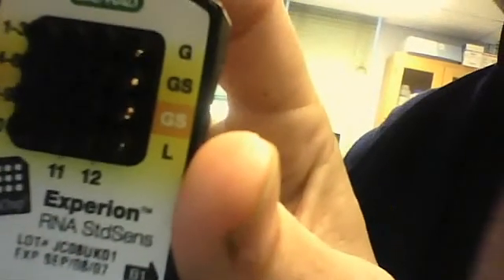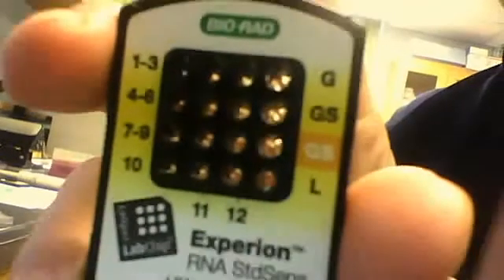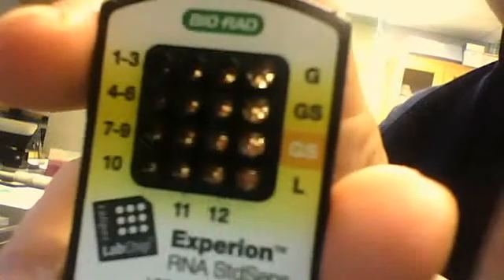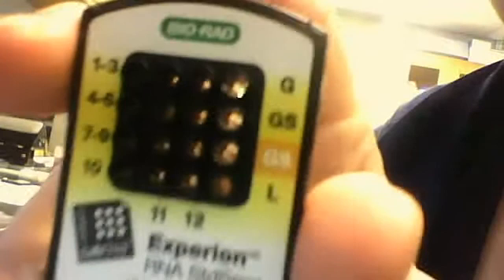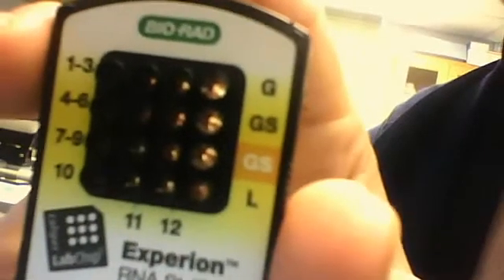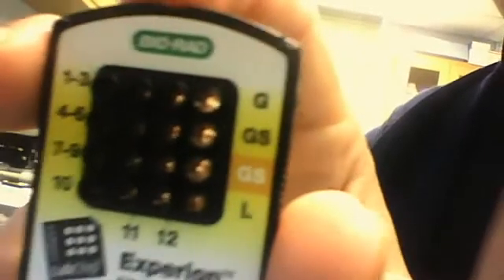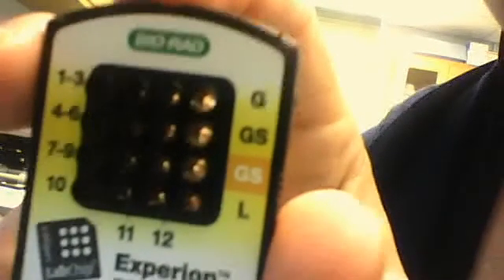And then you're ready to load your ladder, which is down there at the bottom of the chip. It says L on the chip. You want to load five microliters of the buffer, which is the yellow top, into there, as well as every well that's loaded for your samples, all 12 wells. So all of your sample wells should have five microliters of buffer, as well as one microliter of each sample. And the ladder should also have five microliters of buffer, and then one microliter of the ladder. And that comes with the kit. It's in a red top.